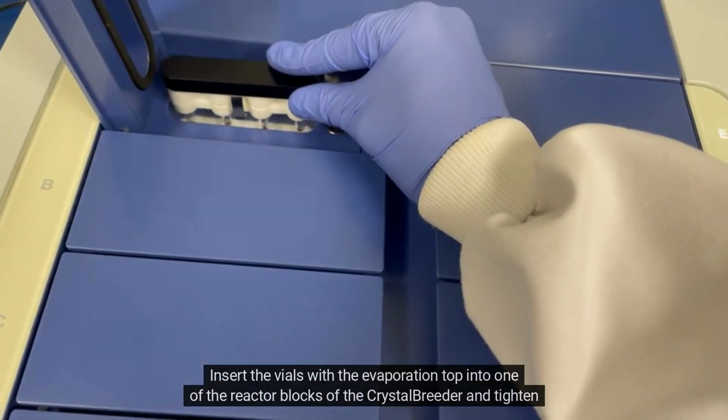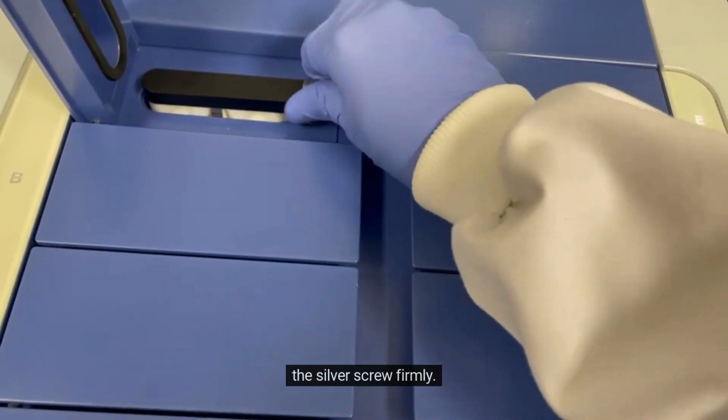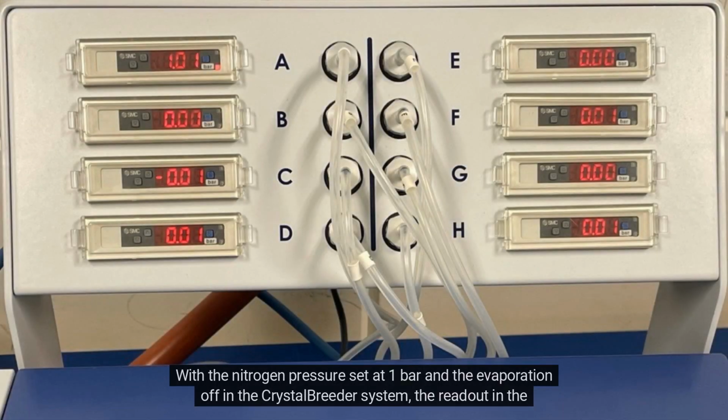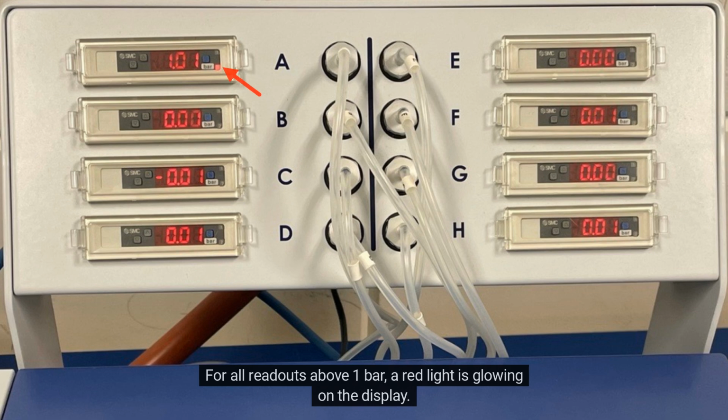Insert the vials with the evaporation top into one of the reactor blocks of the CrystalBreeder and tighten the silver screw firmly. With the nitrogen pressure set at 1 bar and the evaporation off in the CrystalBreeder system, the readout in the display should be 1 bar. For all readouts above 1 bar, a red light is glowing on the display. This is an extra indicator that there is no vacuum in the circuit.